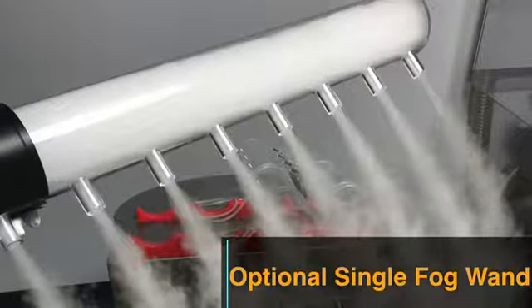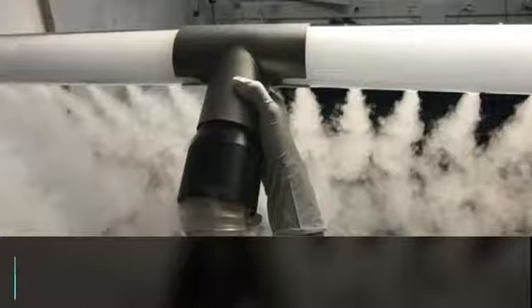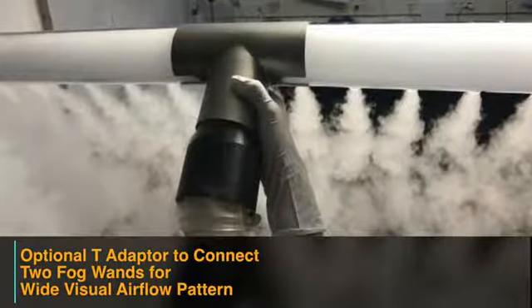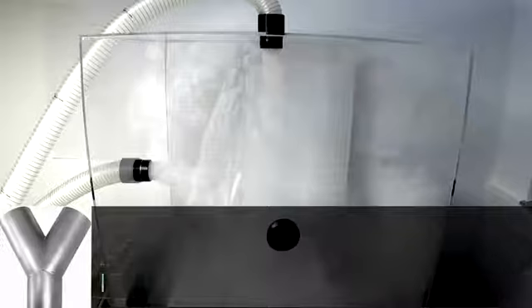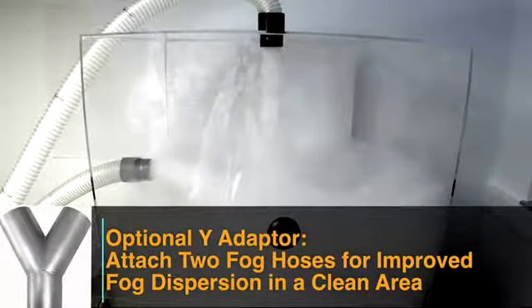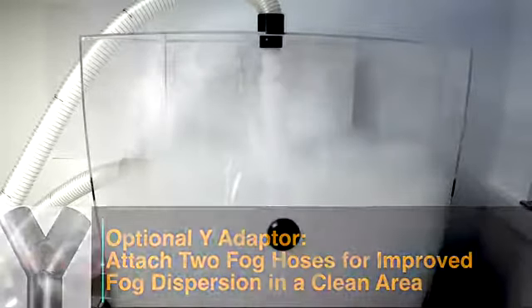Larger cleanrooms, sterile rooms, and ISO suites need higher fog volumes and density when testing HEPA airflow velocity in critical areas, checking negative pressure areas as doors open and close, and verifying no unwanted air migration from break rooms entering into cleanrooms. Two fog inputs into a test area can be useful, all of which is available with the AP35 to test airflow according to ISO, USP, and semiconductor specs.